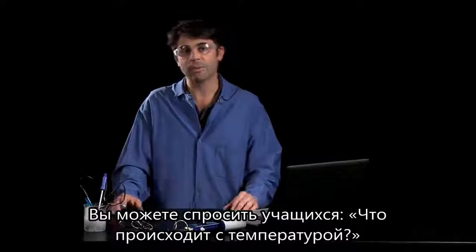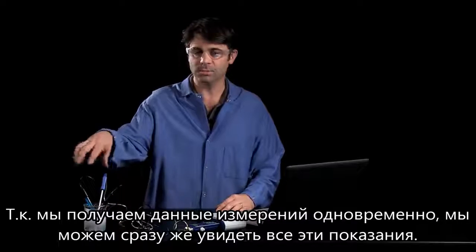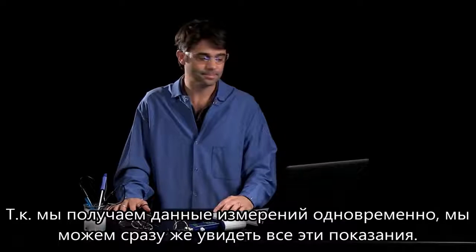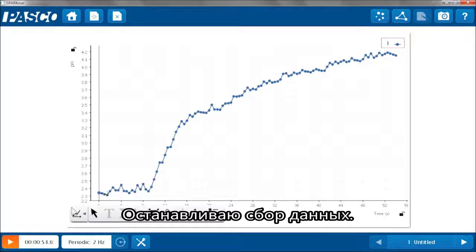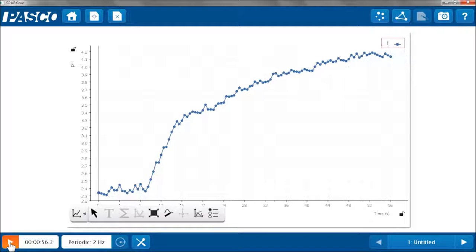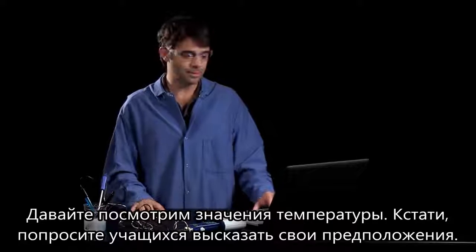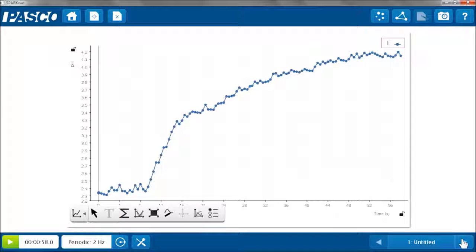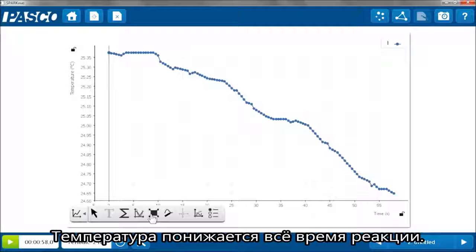You can ask your students, what's happening to the temperature? What's happening to the conductivity? And now, because of the simultaneous measurements, we can see all of that at once. So let's take a look. I'm going to stop my data collection, and now I'm going to look at the temperature. Again, asking students to predict what happened. And then you can reveal that, after we auto-scale it, the temperature was actually going down the whole time.